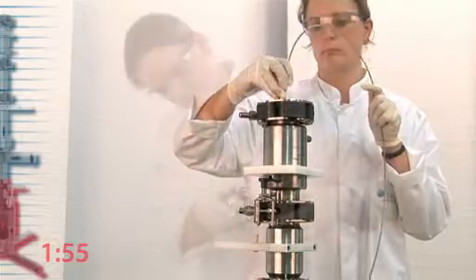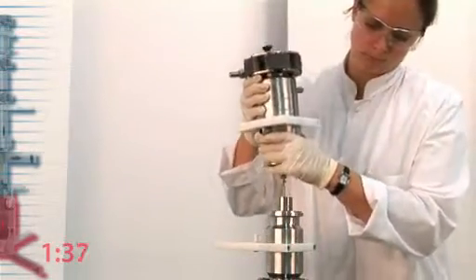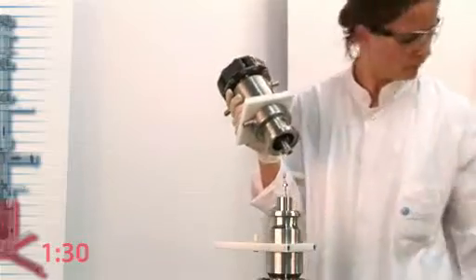Lastly, we separate the column from the support. As you can see, the column and the support are now completely disconnected.